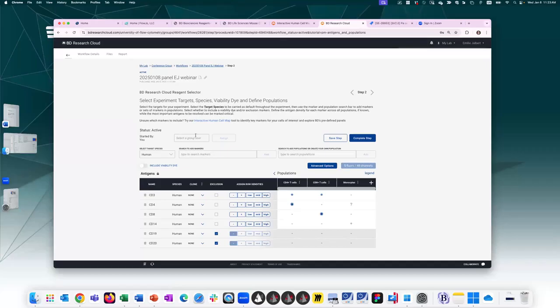What you may have noticed is that we have these boxes at the top of every step. So the step has been started by me. I can always choose to assign it to another member of this BDRC org. So members of your orgs are usually your lab mates. So if ever you're working with another person in your lab to design this panel together, you can send it back to each other by assigning the steps. So let's say I could assign it to this person. I would just press assign. They would get an email saying, hey, there's something for you to look at in BDRC. Let me know what you think.